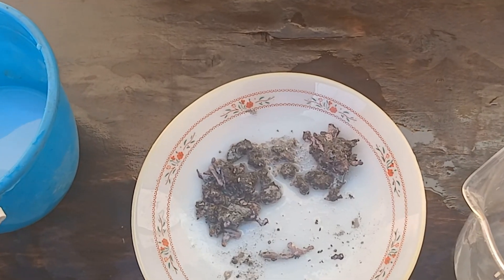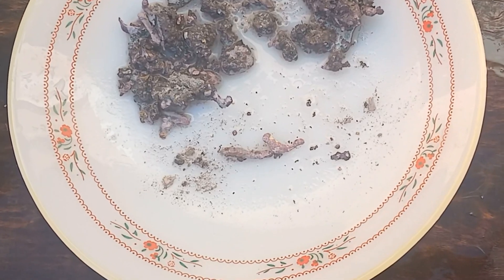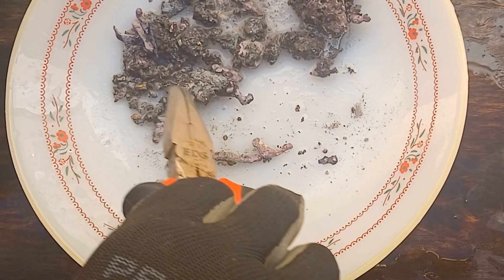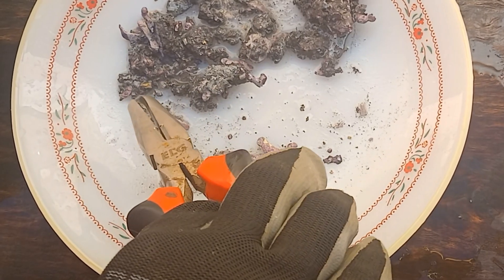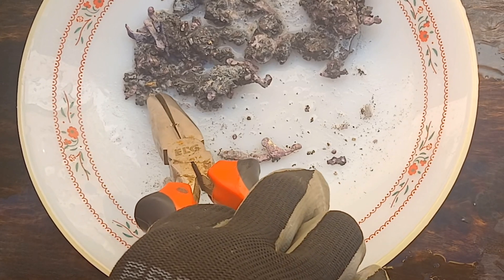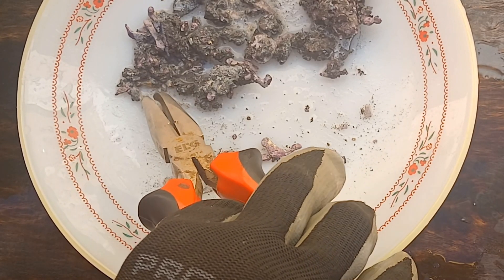We leave it overnight until all of the lead and zinc are removed. Thus, gold will appear pure on its own, and sometimes as a mixture with copper or a mixture of the rest of some other metals.